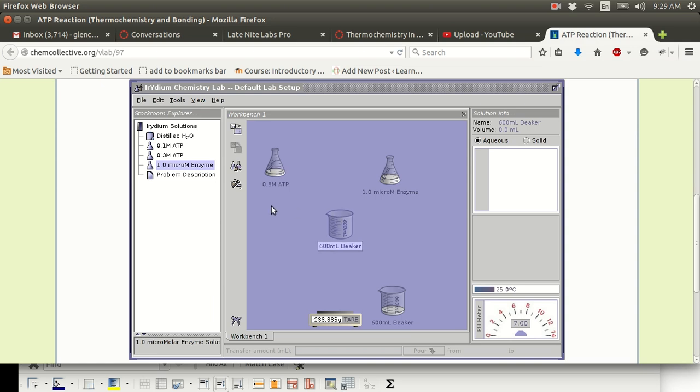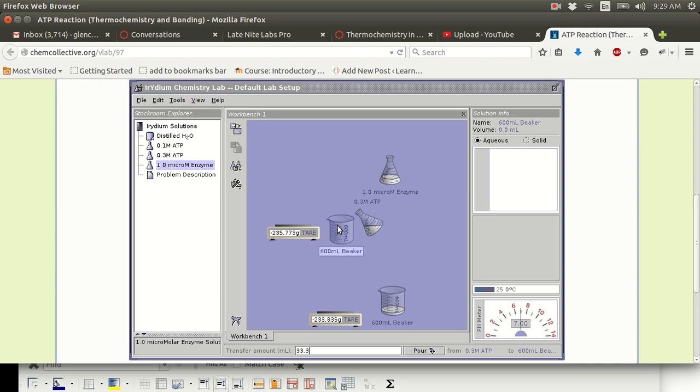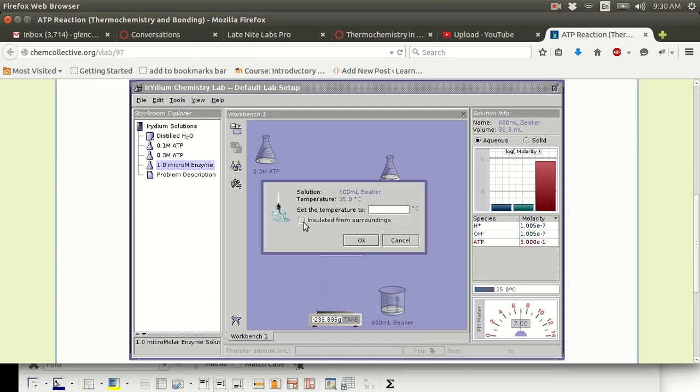You get your empty beaker. You get the mass of the empty beaker, or you tare the scale to the beaker. You add your ATP solution, and then you right-click on the beaker. This is a step that's not in the instructions, and it's not required. It's just a hint to make your lab a little easier to do. Right-click on the beaker, select Thermal Properties, and then select Insulated from Surroundings. Click on OK.